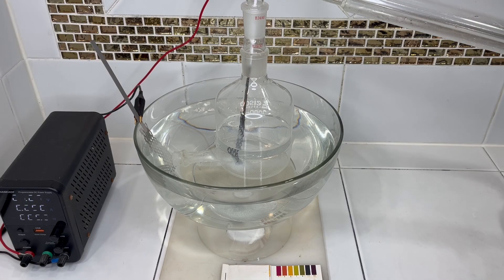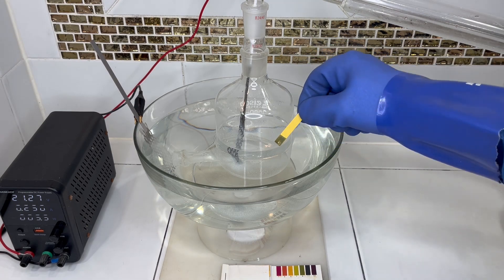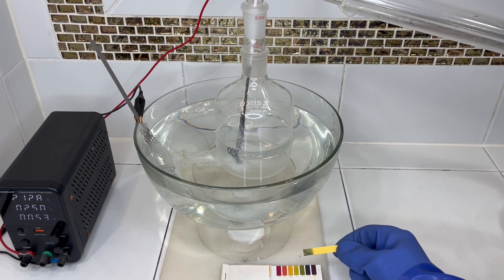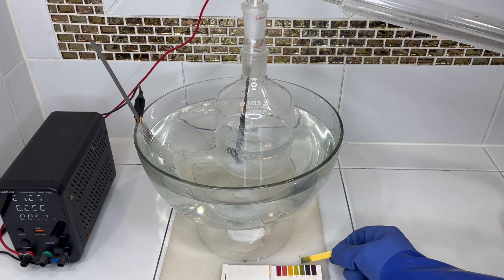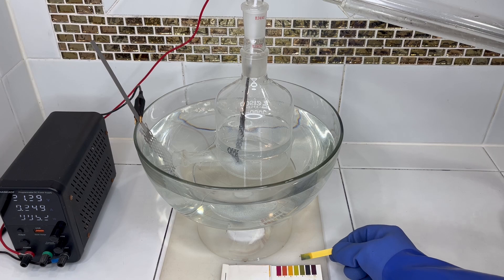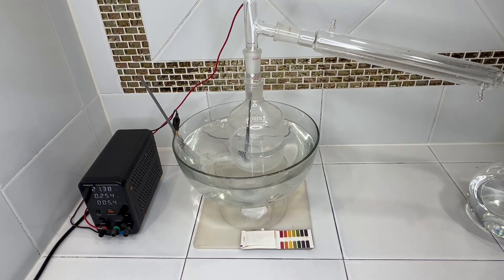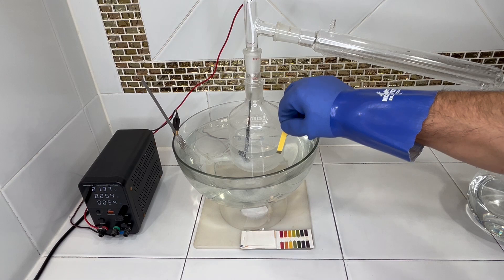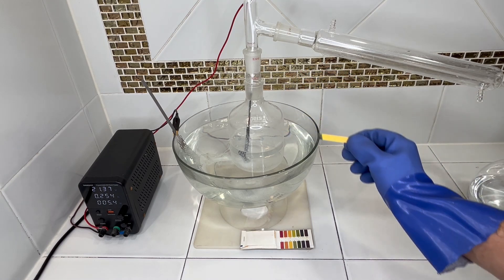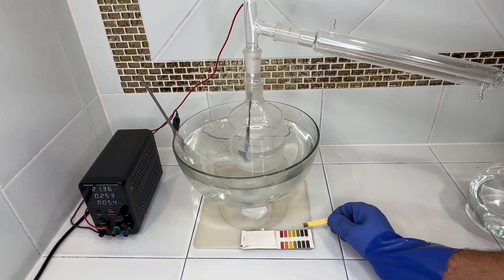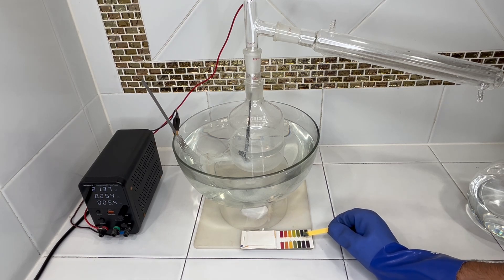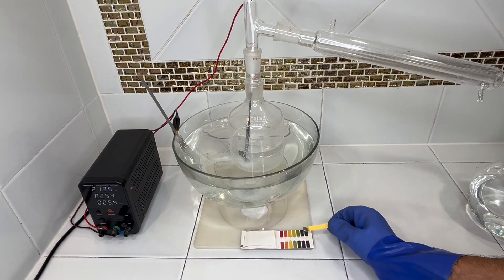So the system's been on for about two and a half hours, and I'm going to go ahead and take a pH test. It's looking like we're around nine. So now we're at three and a half hours. And the pH is getting closer to, looks like about a 12. 11 to 12.